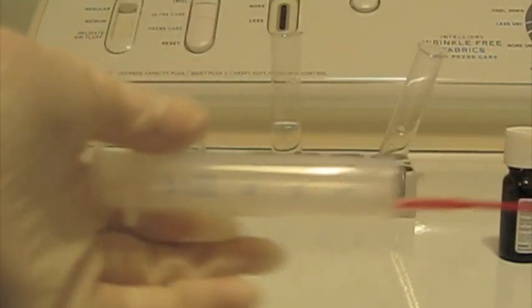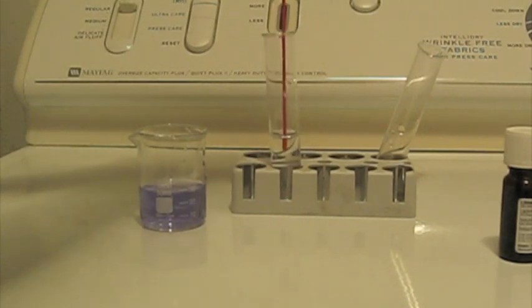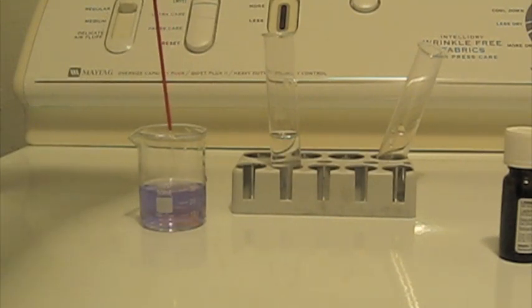If you want to make more concentrated hydrochloric acid, use more chemical or less water than I did, because that hydrochloric acid I made is very dilute. It's probably because I didn't heat it long enough.